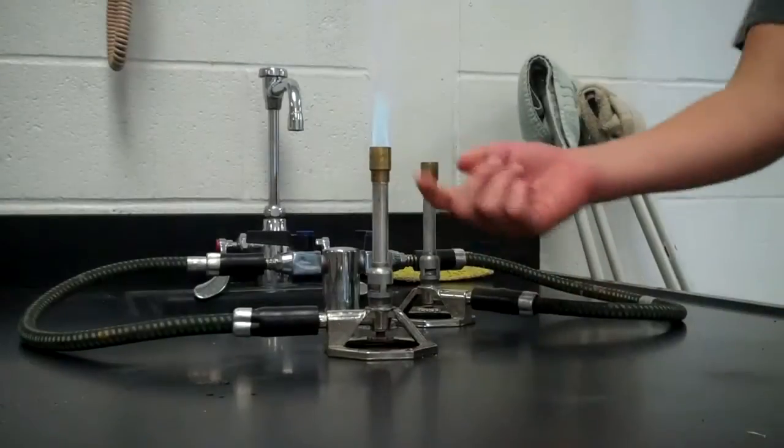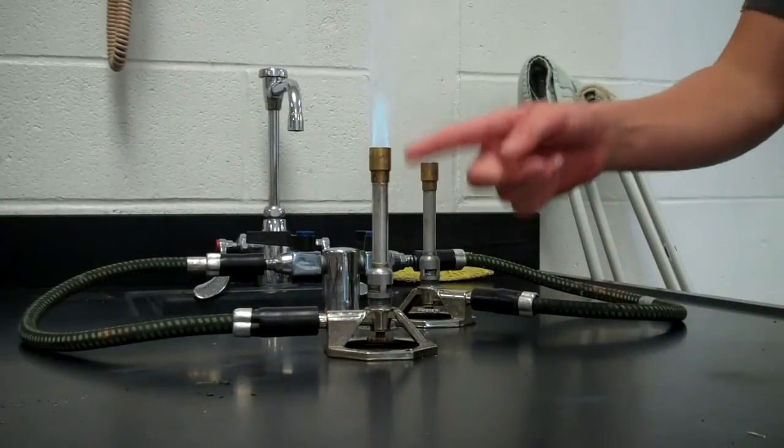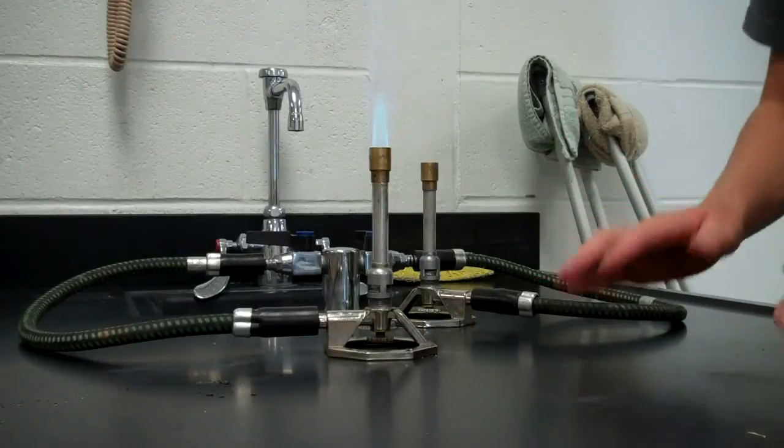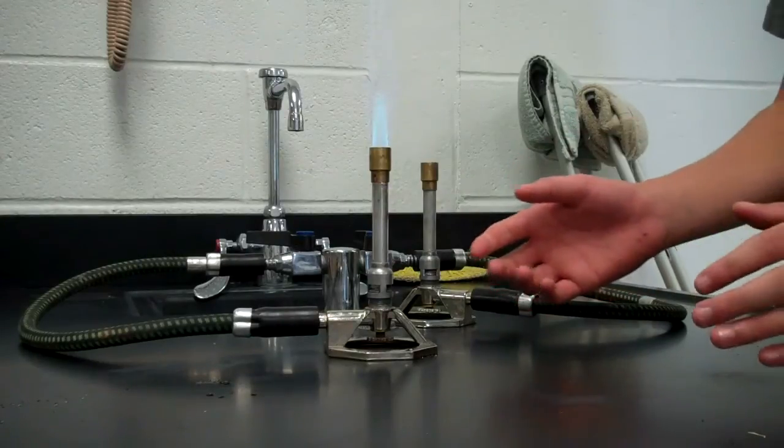If you touch this part right here, the top, you'll get burnt. Your finger will literally fall off, whole fingernail and all. You'll be able to see your bone for the first time.